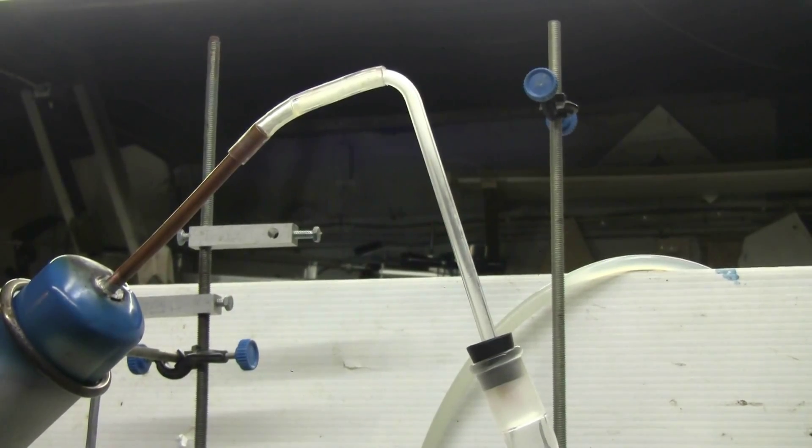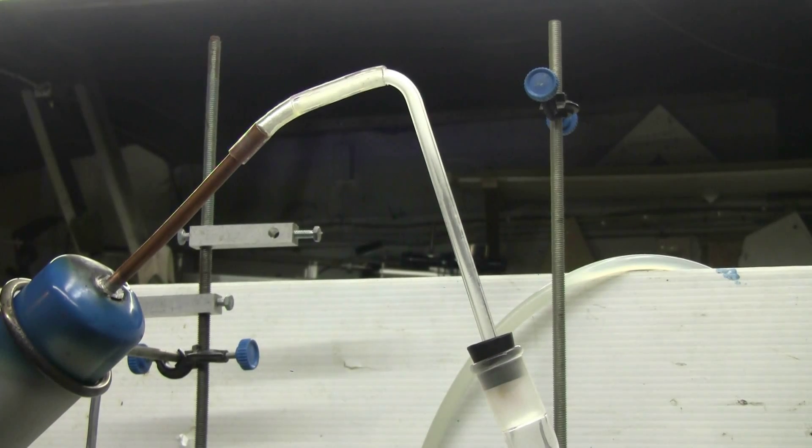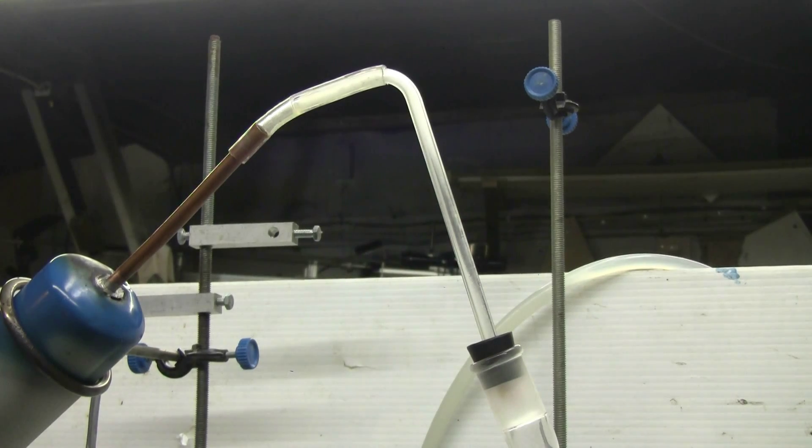After about nearly 10 minutes of torch heating, material is starting to flow out of the steel reaction vessel and into the condenser.